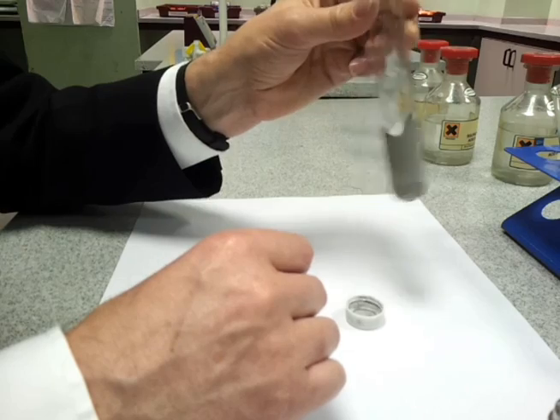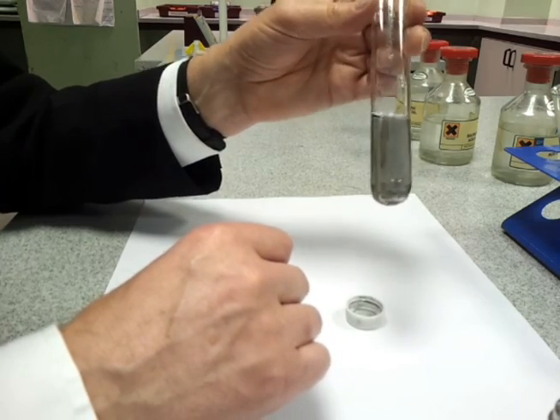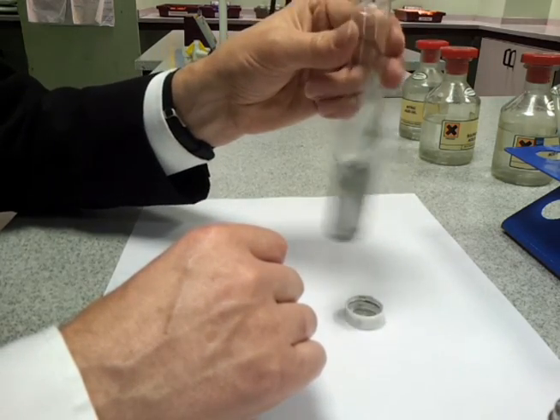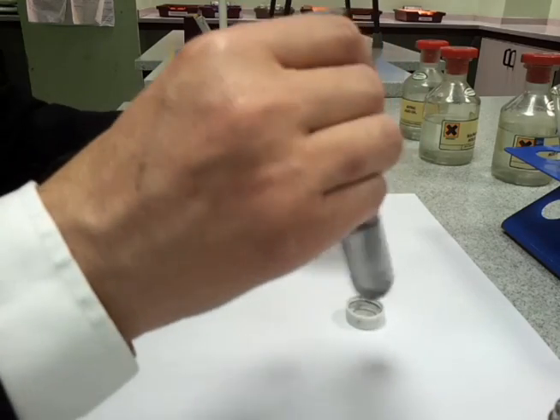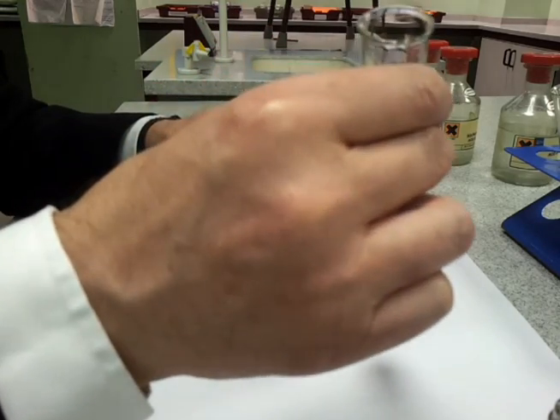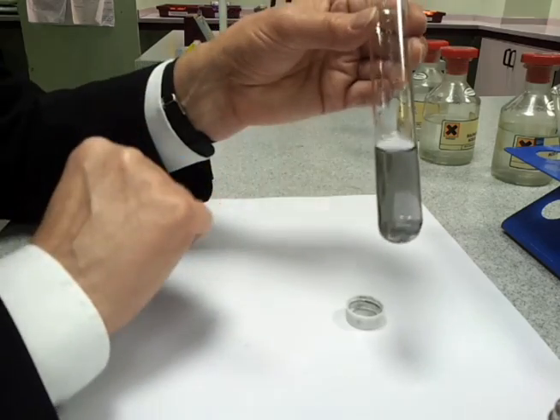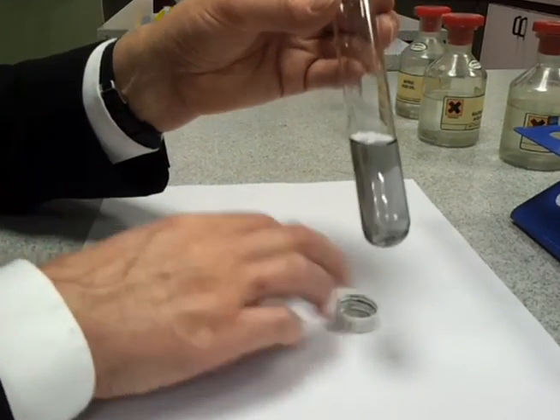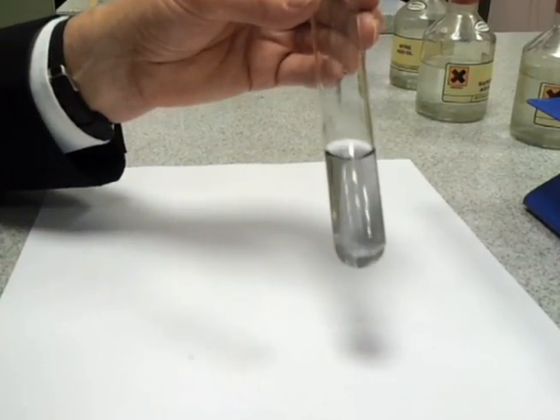You need to watch carefully to see the signs of a chemical reaction. You can see we're starting to get a color change, and if we look at the tube now, we can see that it's turned blue.